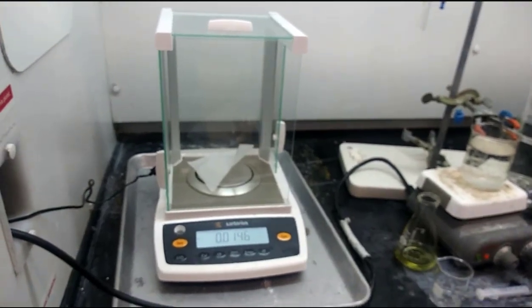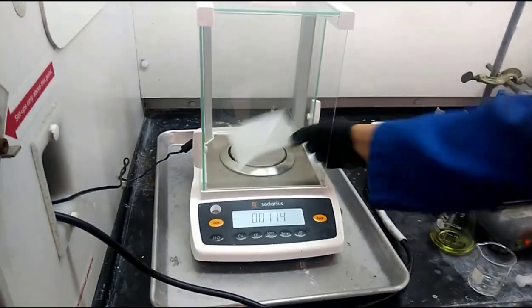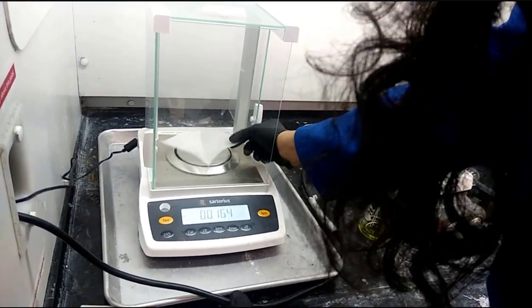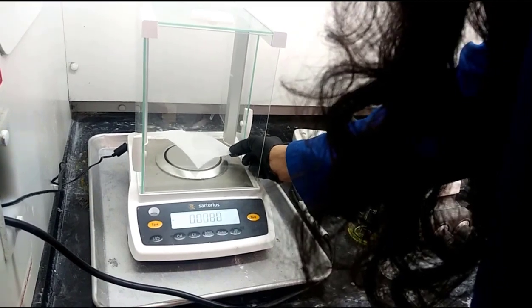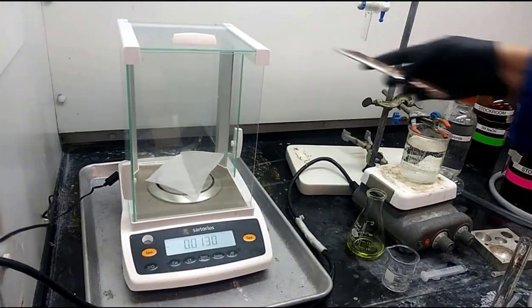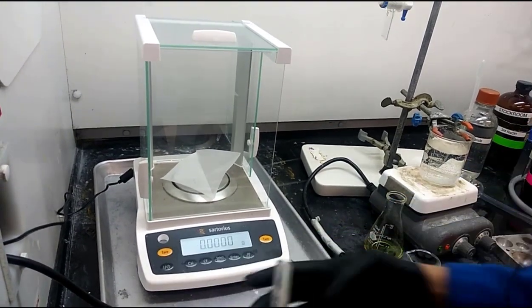And this potassium carbonate is very important because, remember at the end of week 1, in step 11 of week 1, the final product that they put in a vial had solution and solid.